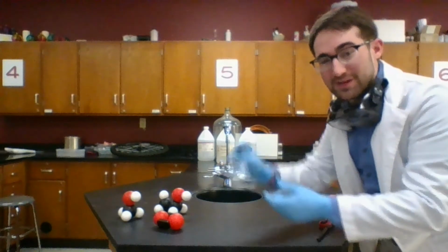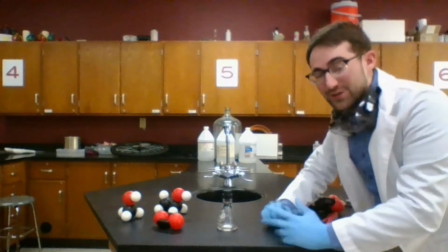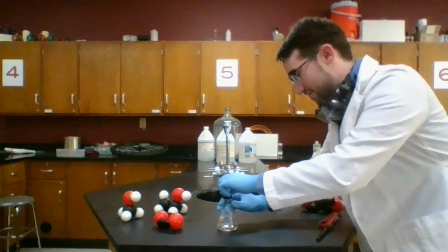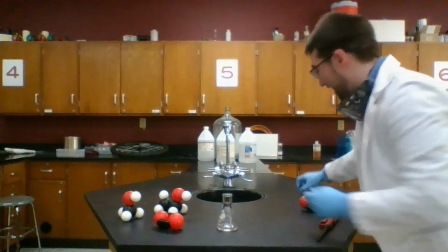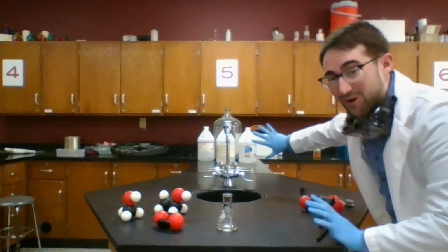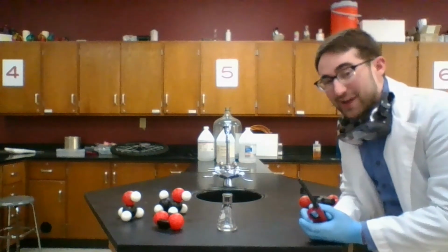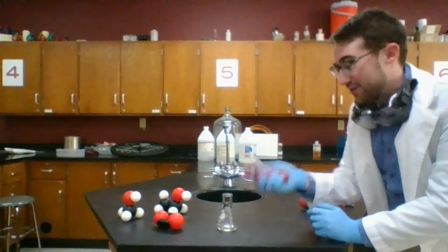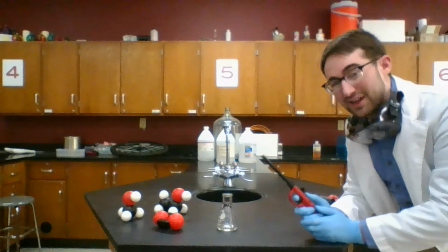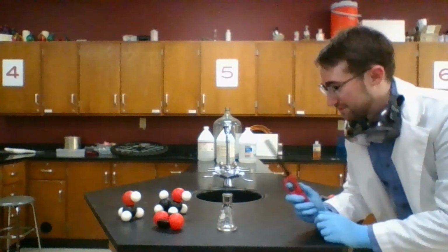I'm going to shake this up, swirl it around, make sure that we've got plenty of vapor to combust, to burn with the oxygen that's already in the air. Take the stopper off. I have moved the ethanol, methanol, and whatever else that's combustible far away so that I don't have any runaway reactions. And to kickstart the reaction between our ethanol, methanol, and the oxygen that's already in the air, I just need to use something like this, a lighter, to give a little bit of energy at the beginning to get everything moving.